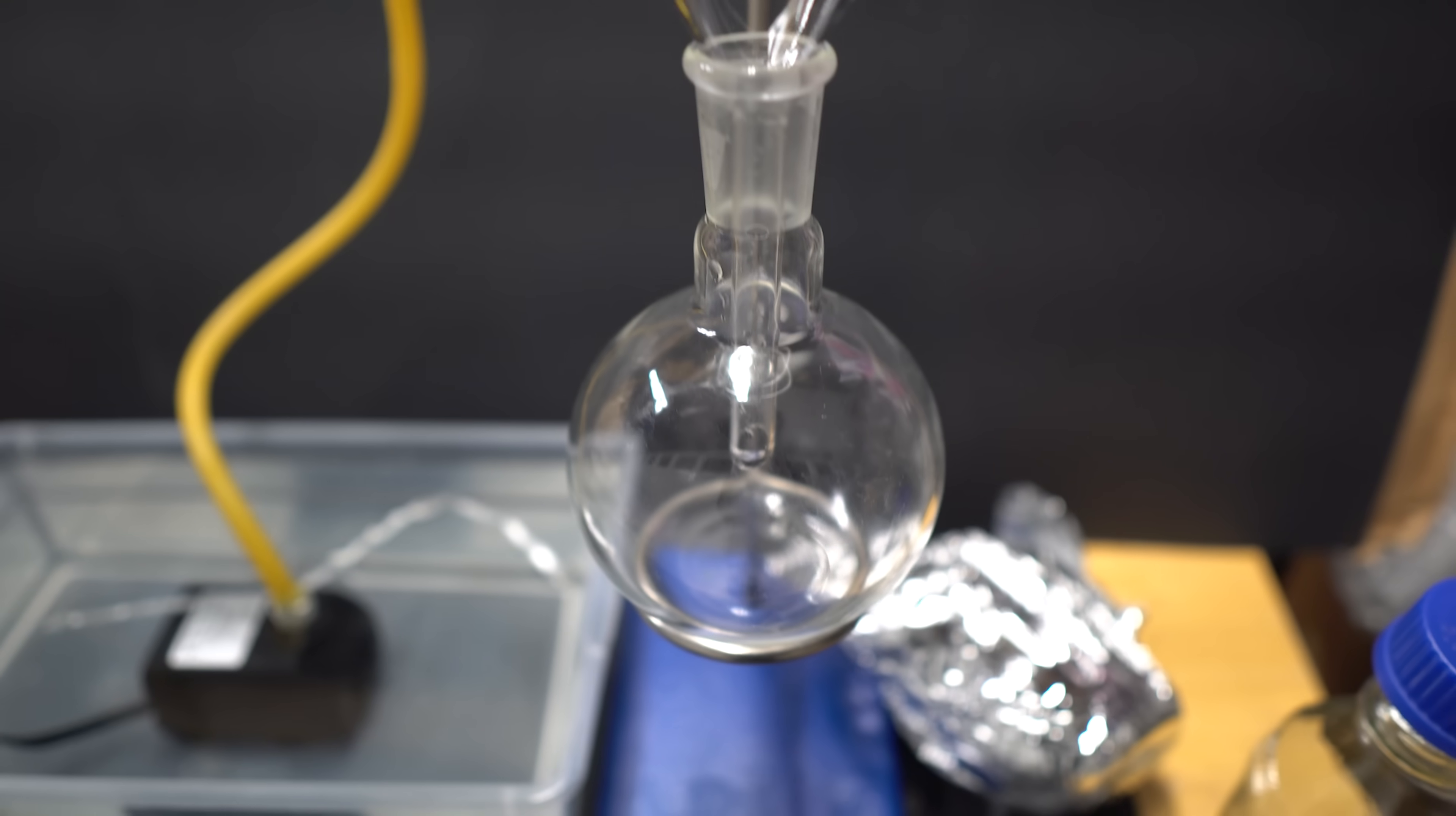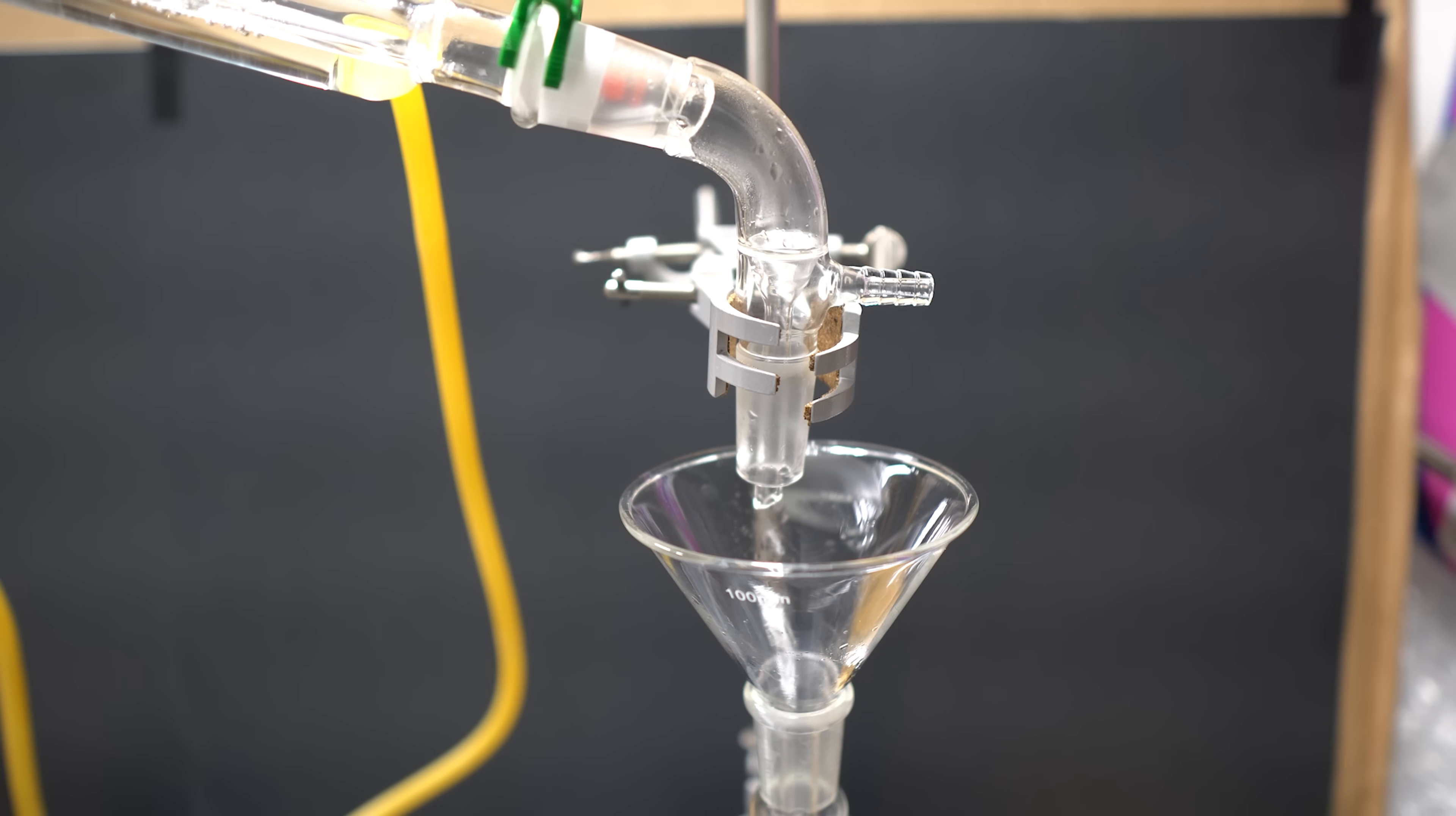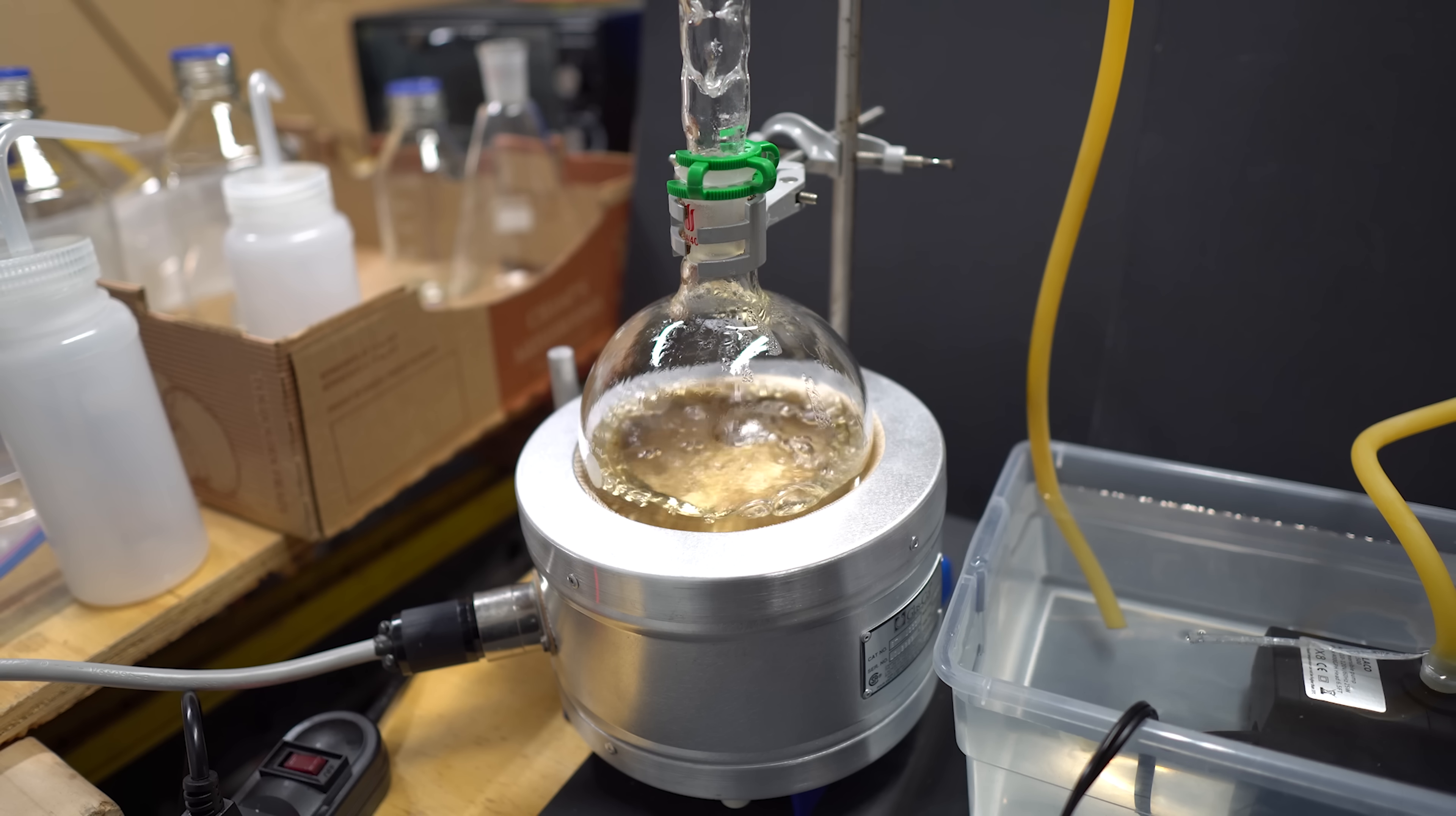Now, I do have kind of an unsafe way of doing this, but, you know, you kind of have to do that a little bit in chemistry. I just wanted a quick and easy way to put on a receiving flask, and this is what I thought of. Everything that you see dripping into this receiving flask was actually neutralized and discarded. This is something that I don't want, as it's not at the 124 degrees Celsius.